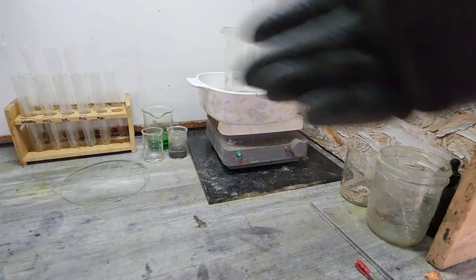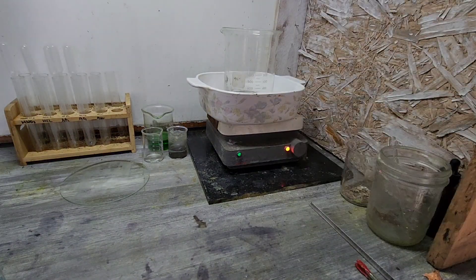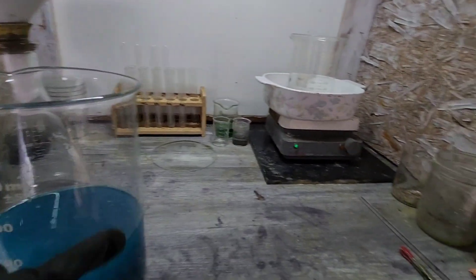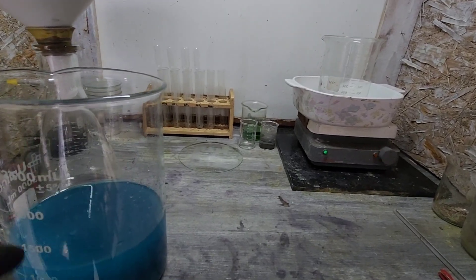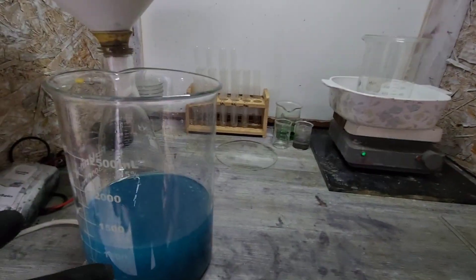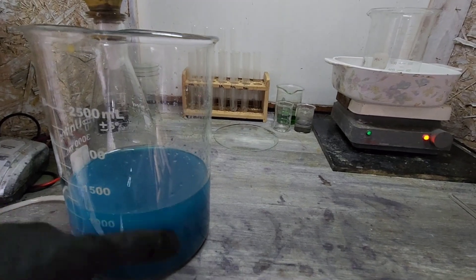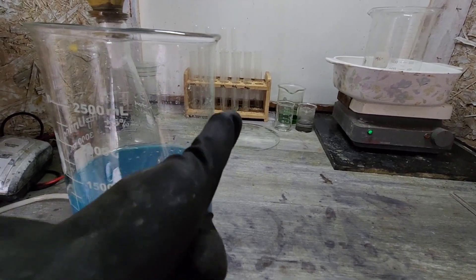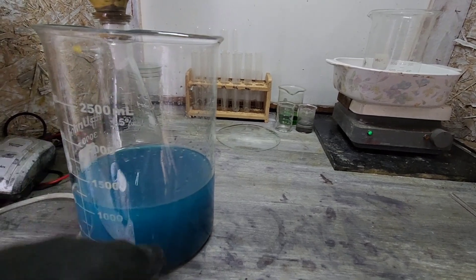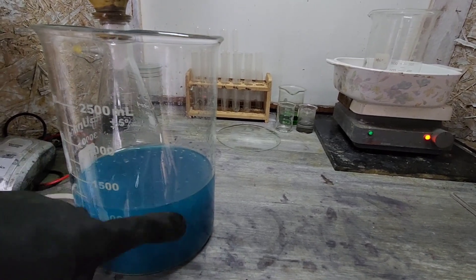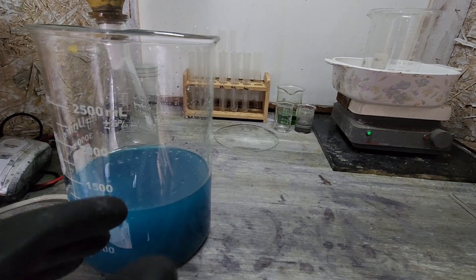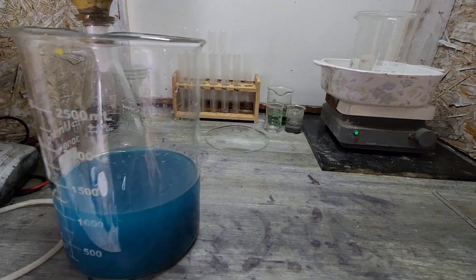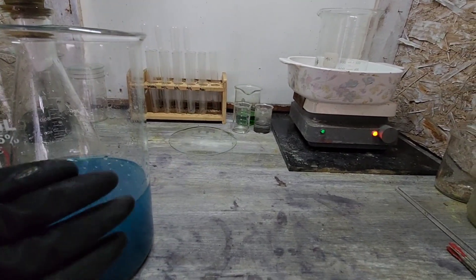And as I'm sure most of you are aware, we feed the cell. And of course, there's going to be a little bit of silver in the bottom of this just because we didn't let it settle after each time. So before dumping this into the stock pot, I'll let it settle out, dump as much liquid out as possible, collect the remains and go from there. And it's a little easier to fish it out of here, nice clear beaker, than it is out of the stock pot. So we'll get this later.